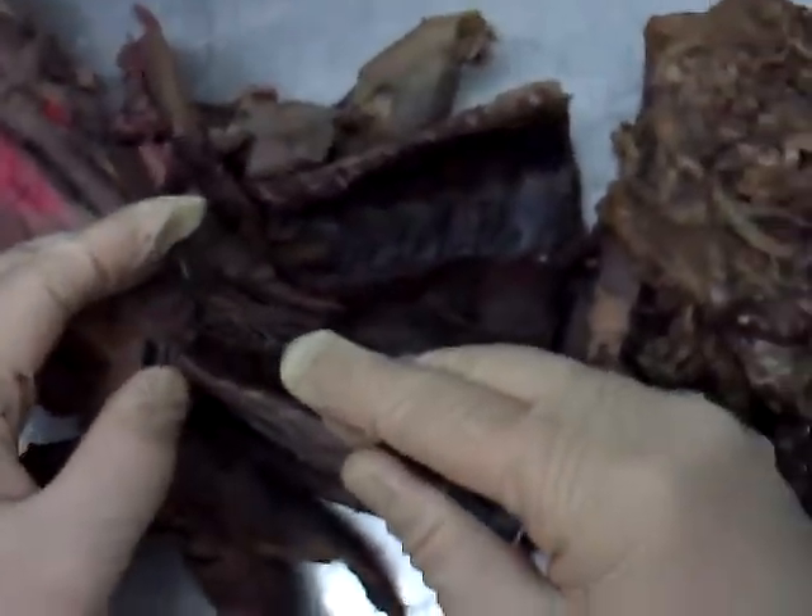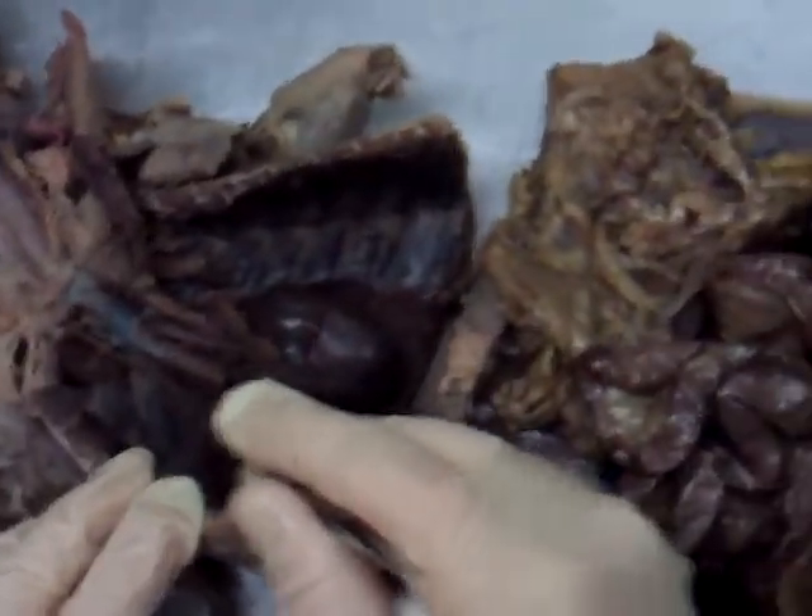The vagus is way back up here in the neck — that's the vagus nerve. This nerve sticking out right here — actually, this thing is the superior vena cava sticking up there; that's not a nerve at all.